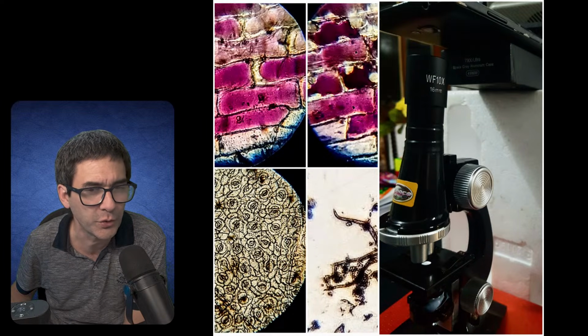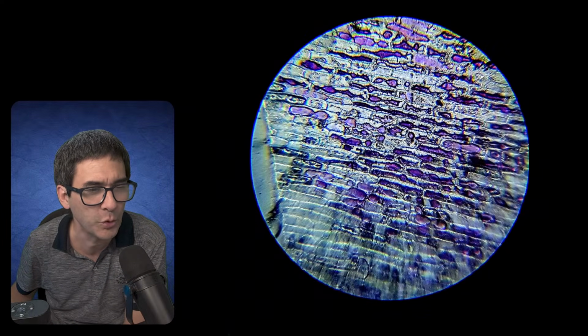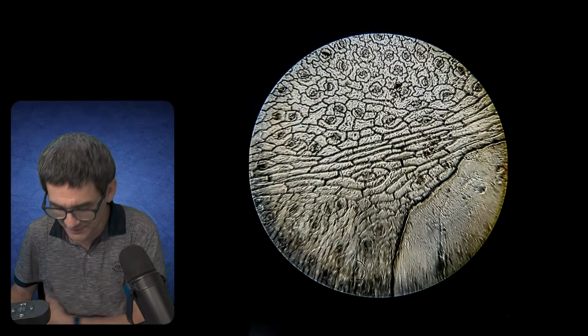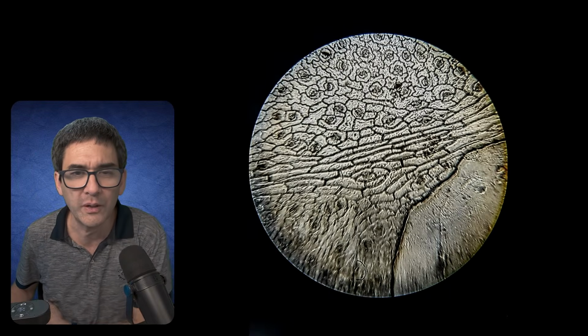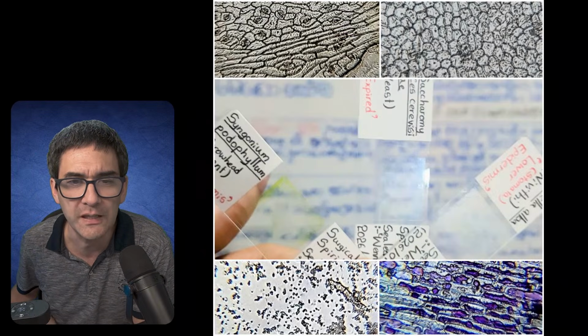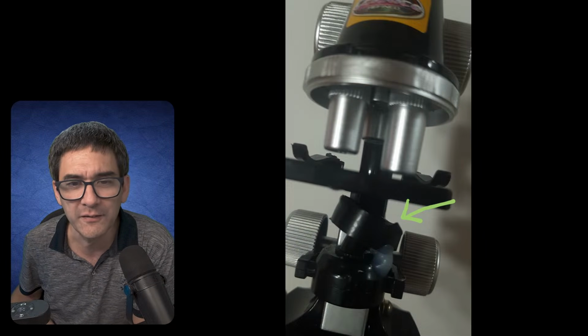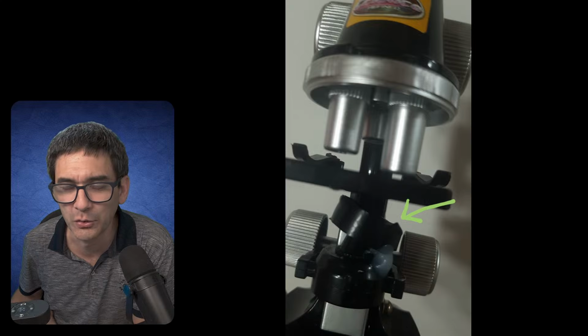So first of all, thank you for showing this to me. This is a microscope modification, and I kind of like this as well. Let me start at the very beginning, because this shows the surface of a leaf. If you've joined the live stream, maybe you can also comment on here.